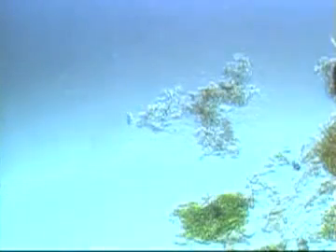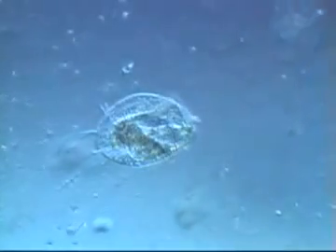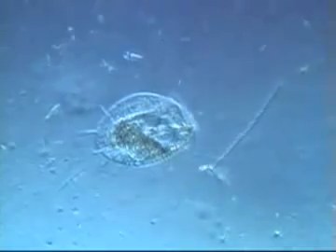The smallest organisms you can see with an ordinary microscope are bacteria. They're the tiny specks jittering about. Most bacteria are so small it would take about 10,000 of them laid end to end to equal 1 centimeter. While they may be small, they grow in great numbers and are an important food for other microscopic organisms which feed on them practically non-stop. In this scene, a tiny pond organism creates a current, directing countless bacteria into its mouth.